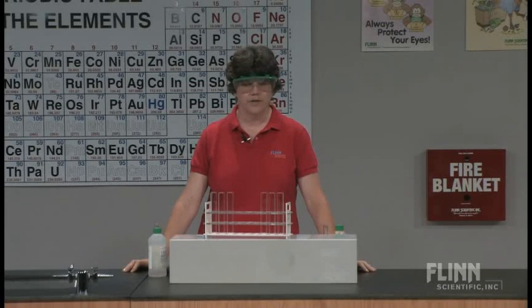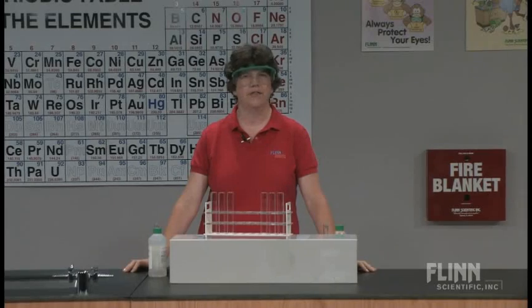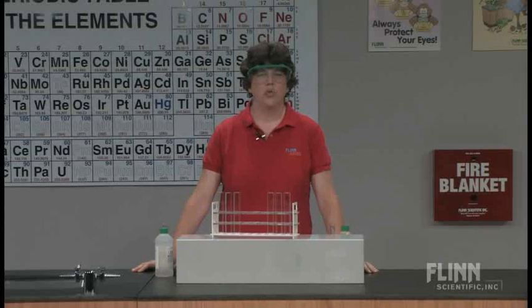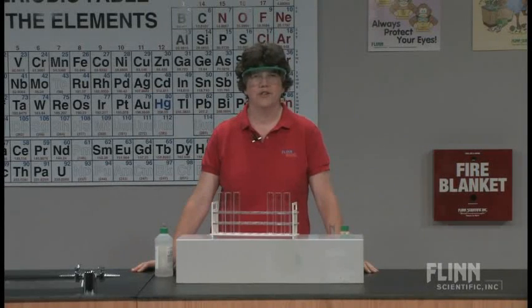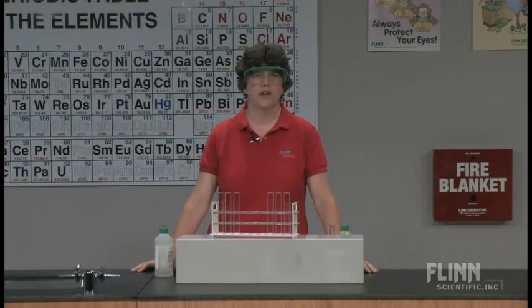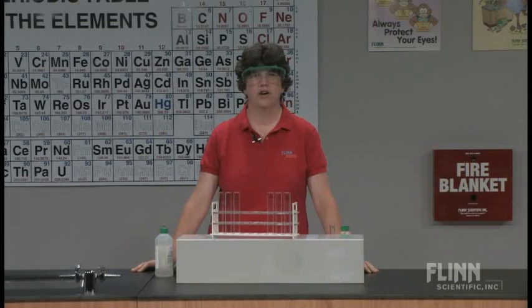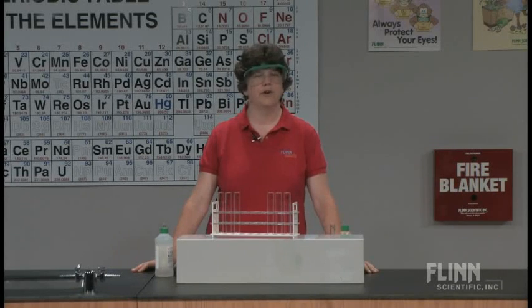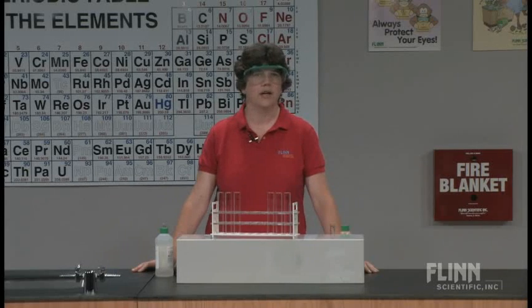Iron is one of those that students don't have a lot of experience with the different colors. There's an iron compound that's red or rust colored, which is iron oxide, and that's what students think of as iron color. Iron color is rusty. Well, I like this lab because it shows different oxidation states of iron and shows some different colors we can get.